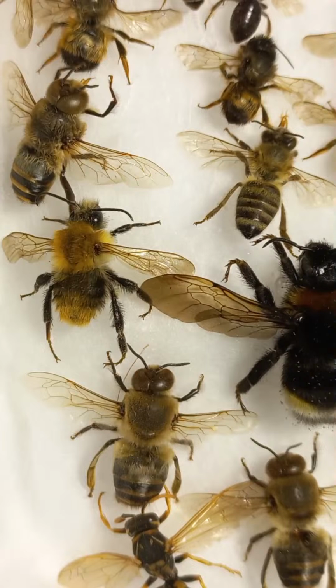Now we can talk about antennae. Antennae are located on the head. Most of the tactile or touch and olfactory smell receptors of honeybees are located on antennal segments. These receptors are in the form of seta or hair tactile receptors and special plates and recessed chemoreceptors. These sensory organs help guide honeybees both inside and outside the hive and enable them to differentiate between hive, floral and pheromone odors.